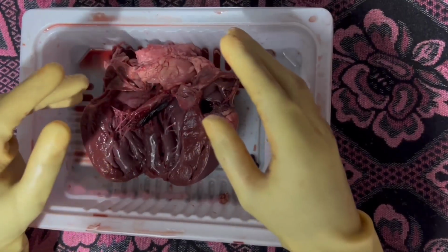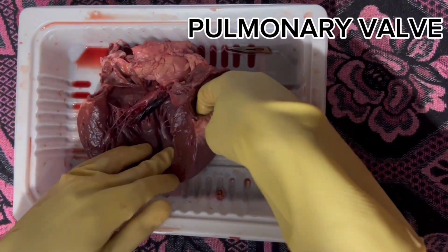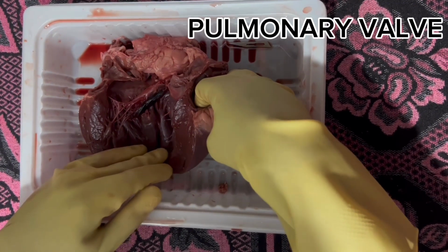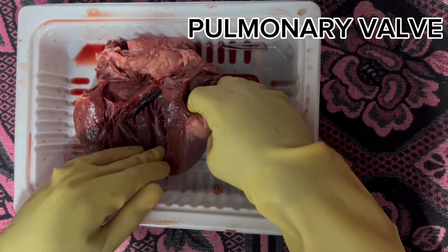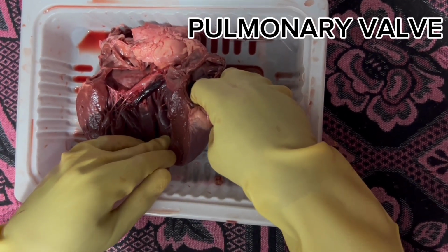Moving on to the other side, we can see the pulmonary valve. This is the pulmonary valve. It manages blood flow from your heart's right ventricle to your pulmonary trunk. Its main function is to help oxygen-poor blood reach your lungs.